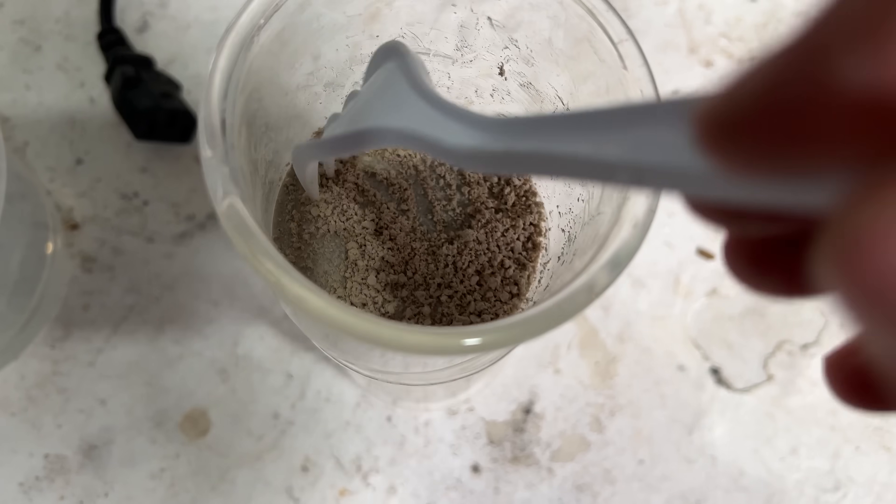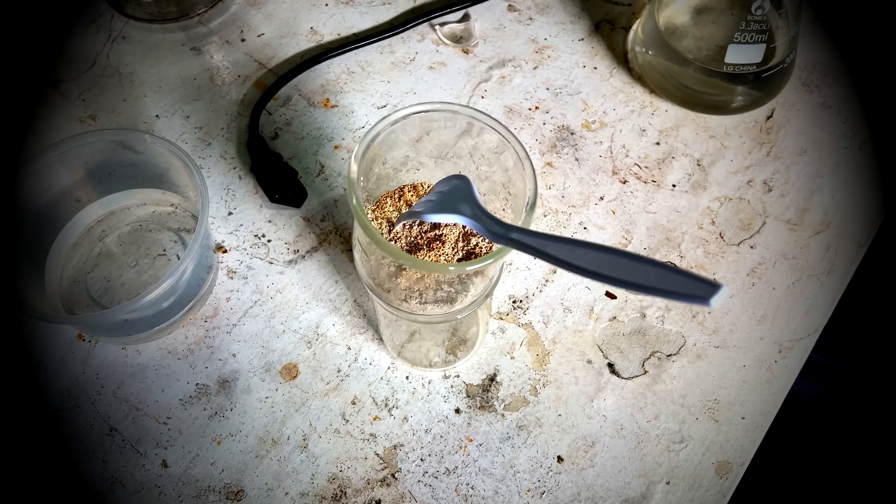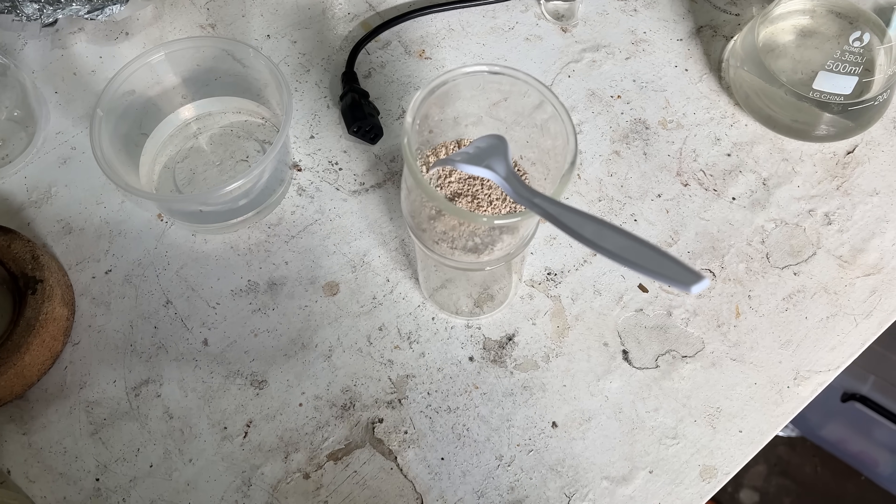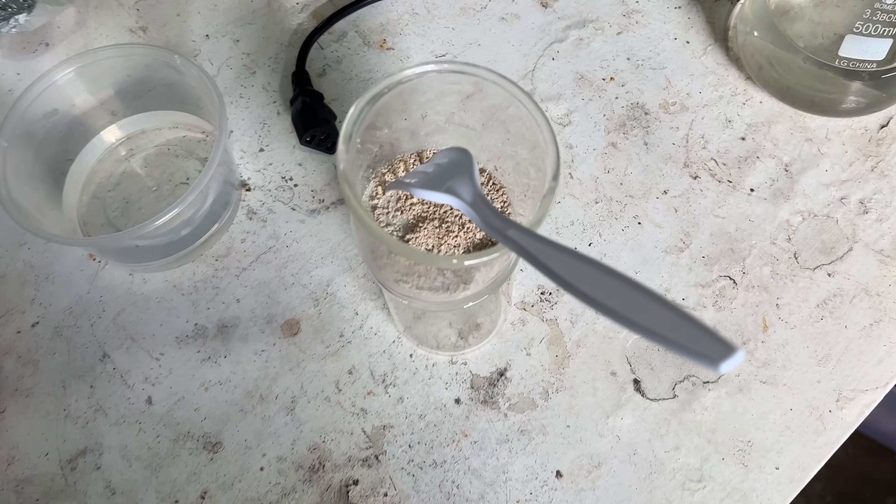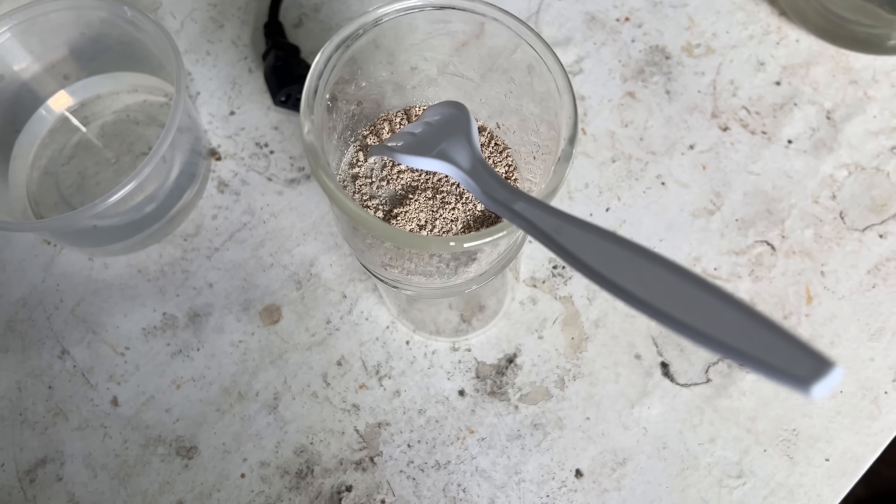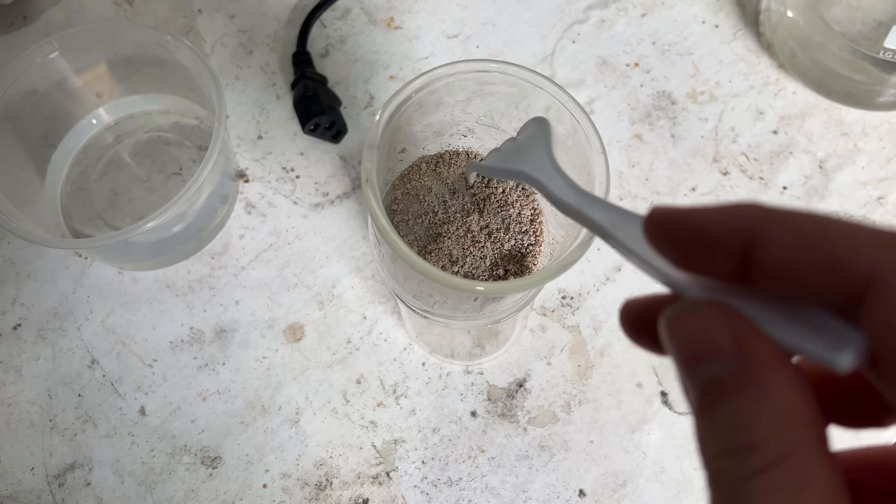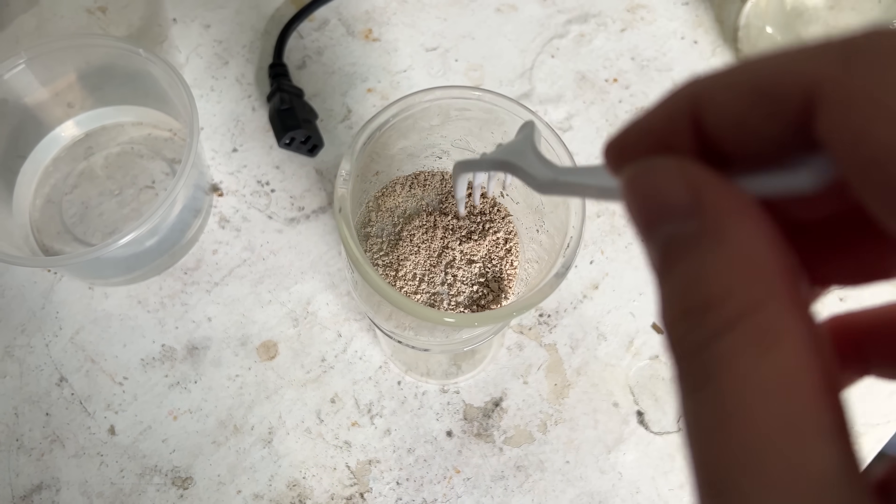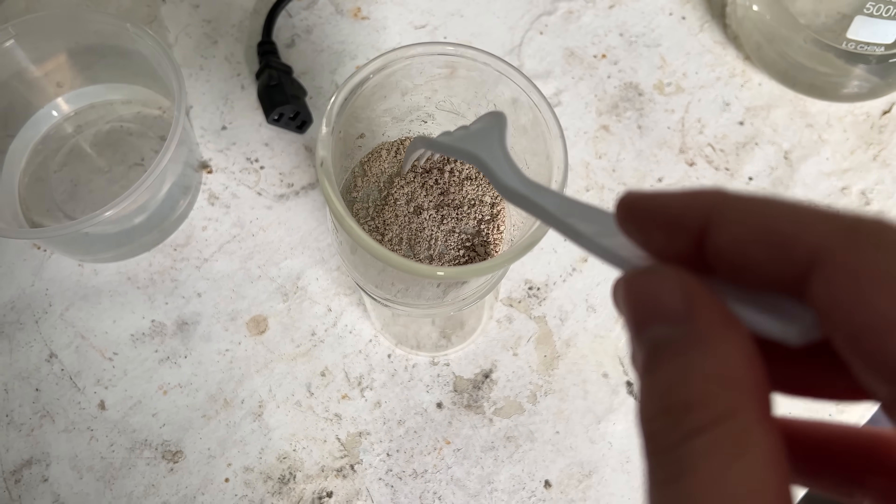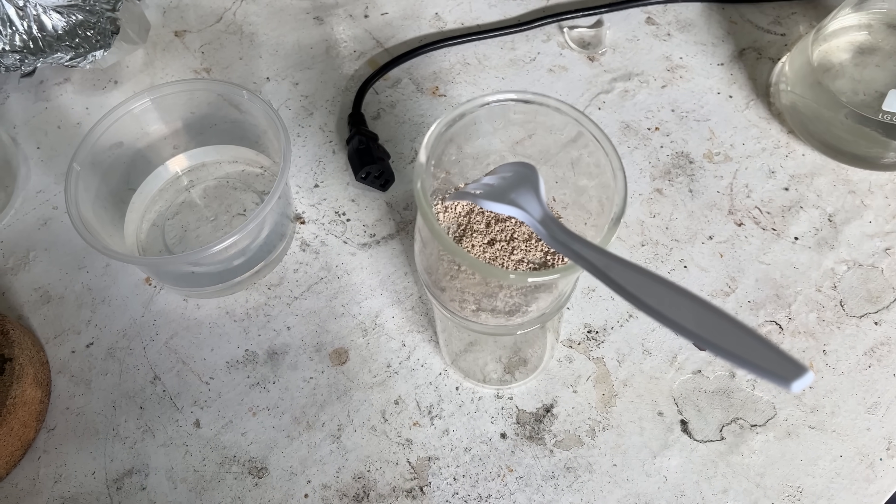And here we are, left with a clay-coloured material in good yield. Things are okay. Because we're doing a photoreaction next, any coloured impurities really will mess with things a lot because they'll strongly absorb the UV and really get in the way of the UV getting to the material, which we need it to. So we're just going to do a re-crystallisation to purify it.